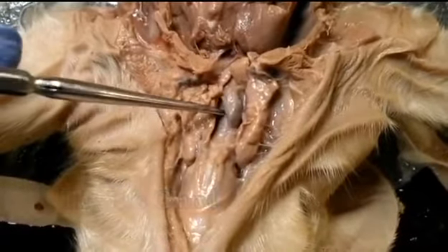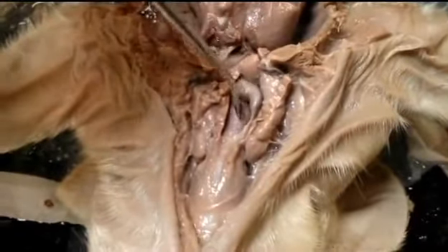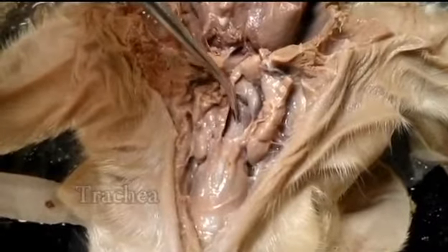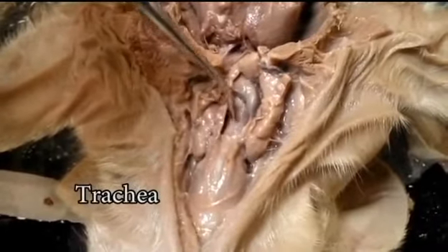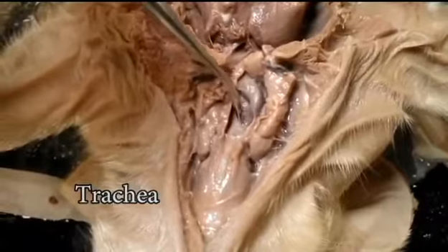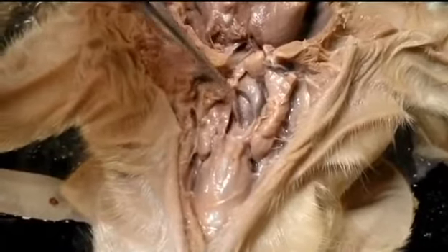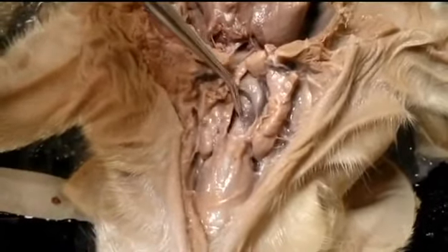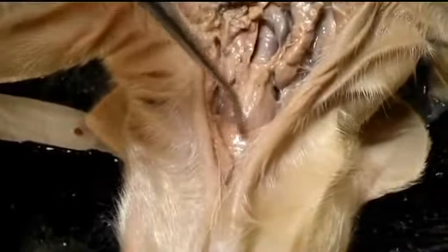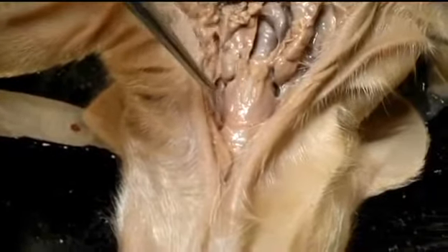If we move the thyroid aside, right underneath that's the trachea. When I run my probe across the trachea, I can actually feel the rings of the trachea. And moving up, this large structure is the larynx.